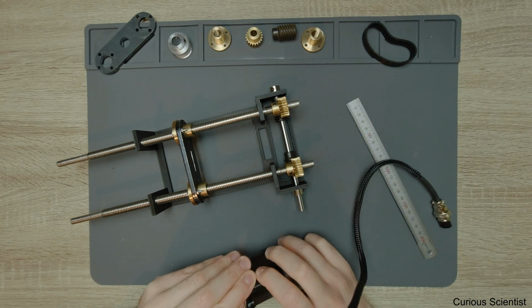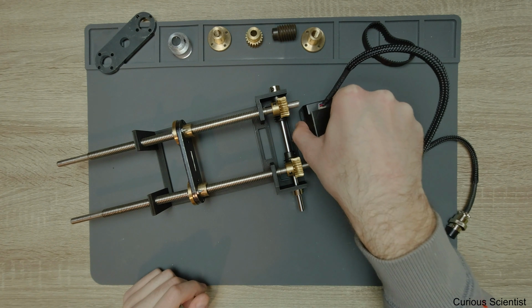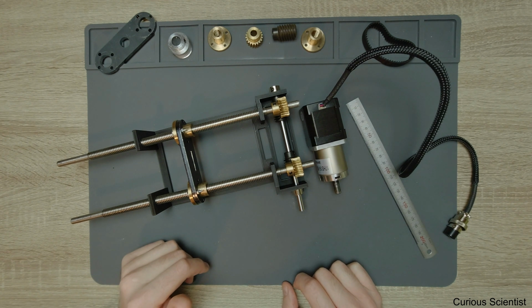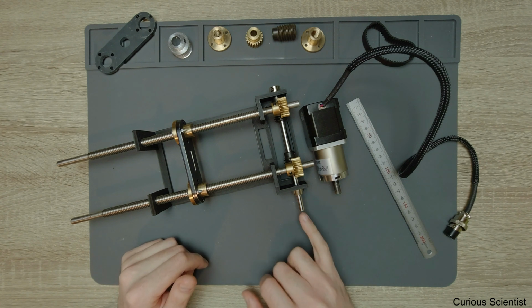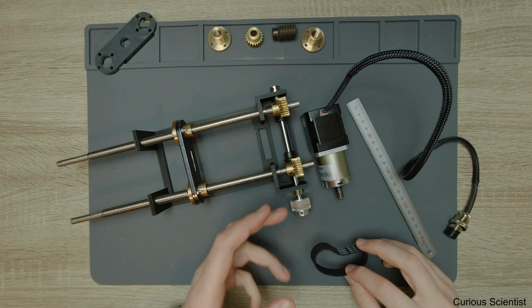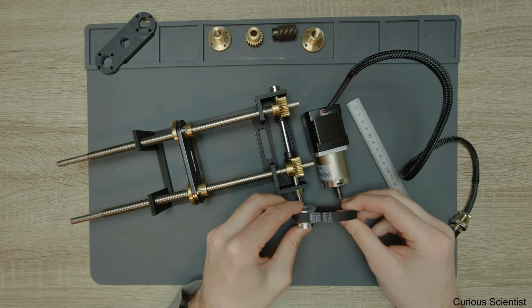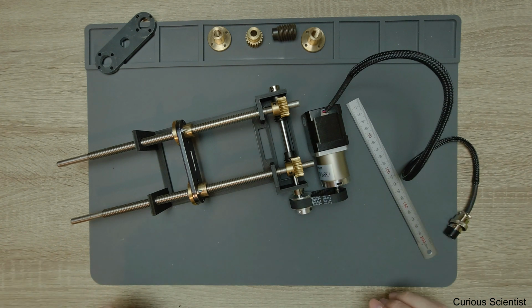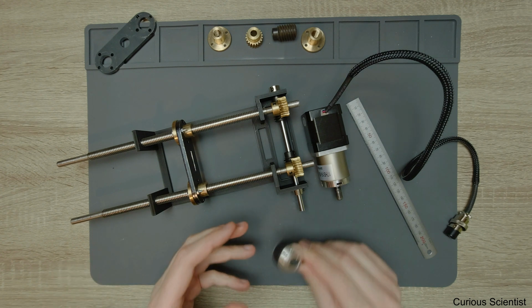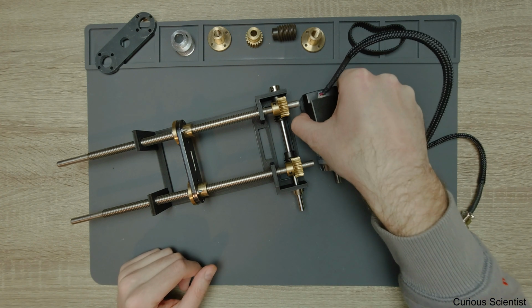Still, I will have to think about the alignment of the motor, but for the first iteration I will put the motor here because I don't care about the length, and this seems to be the best or easiest alignment because I don't have to care about the forces along the axis. So here I just put together two timing pulley wheels, and then I just put the belt, and we are done. So this is a very, very simple solution. But on the other hand, if I want to use the bevel gears, that's more complicated. So I would skip that, at least for now.